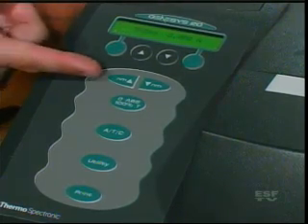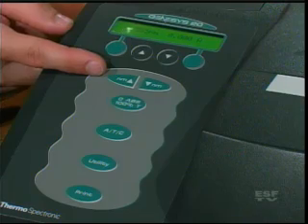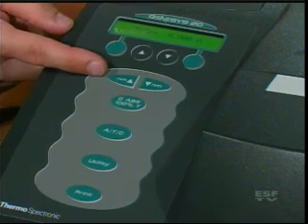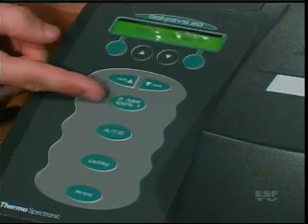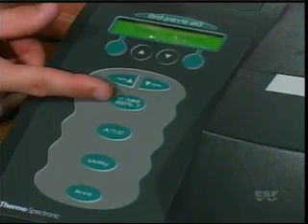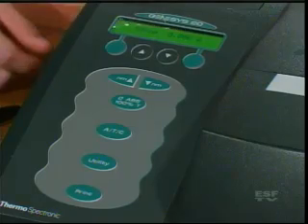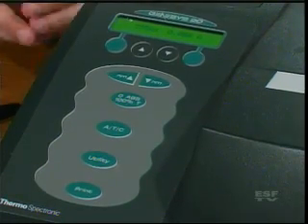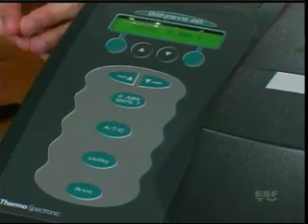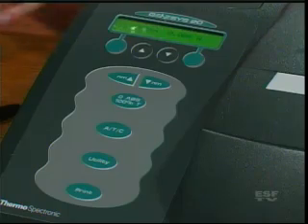We also have the wavelength selection buttons here in nanometers — we can increase and decrease. And then we also have the zero absorbance button, or zero ABS. And what that does is it sets our blank, which we'll talk about in a few seconds.